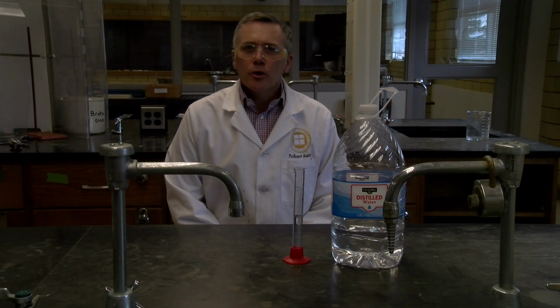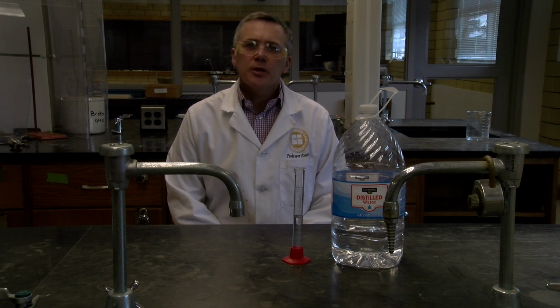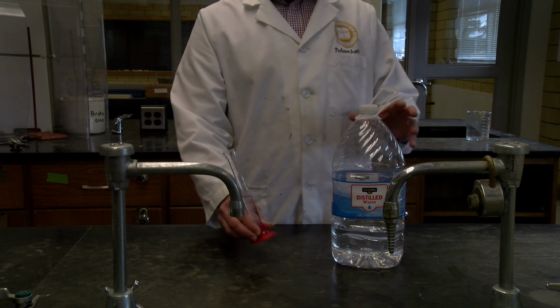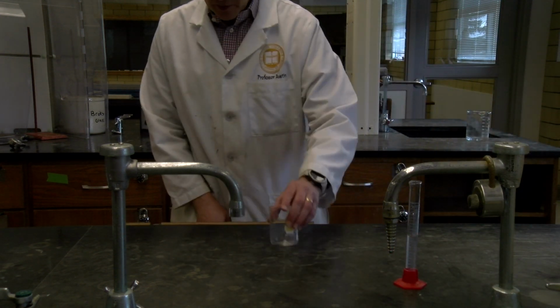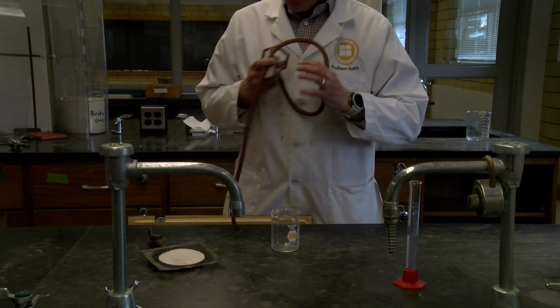For this first part, we need to weigh out approximately 10 grams of maleic anhydride and add it to 15 milliliters of distilled water that has been heated just to boil. So before we get out the maleic anhydride, we're going to get the water heating. I measured out 15 milliliters of distilled water. So we have that working, and now we want to set up a beaker on an iron ring with our Bunsen burner.